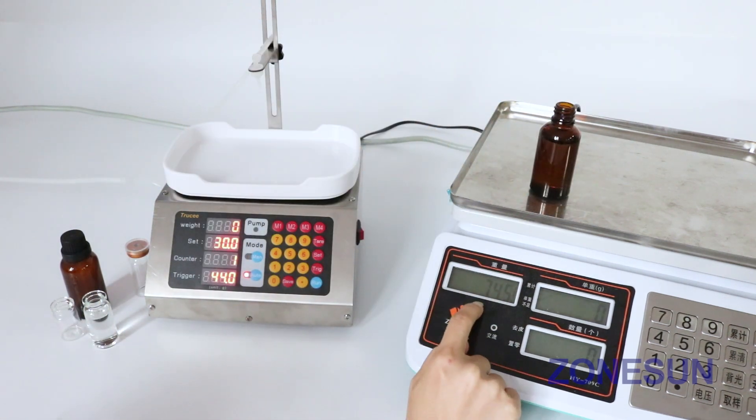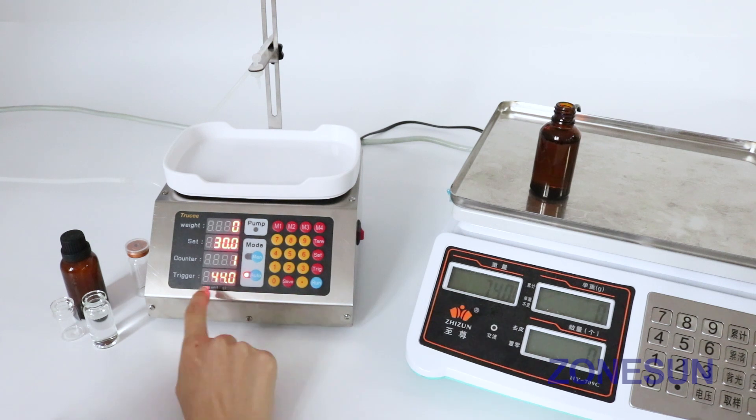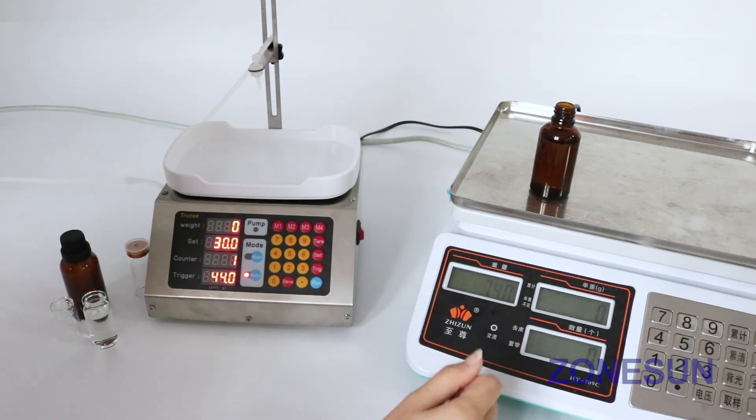You can see that. 74. It is more precise. That's all. Thank you.